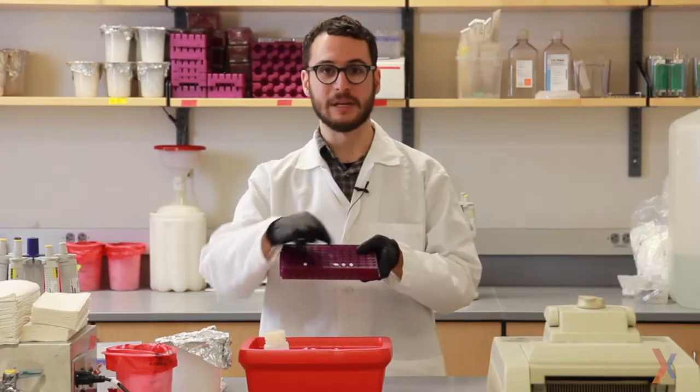I just finished showing you all of the components that go into one PCR reaction. Oftentimes, all of the components of PCR except for the template and primers that you bring in are preassembled into what's called a master mix. Master mixes make pipetting more accurate and convenient and should be used when setting up multiple PCR reactions. I used a master mix to set up these three PCR reactions.